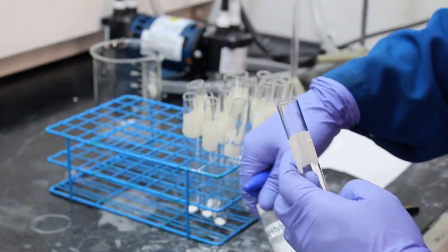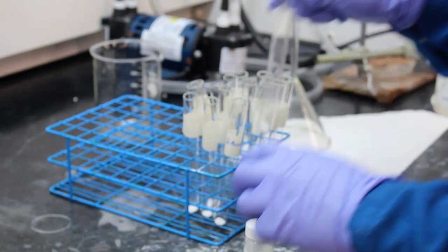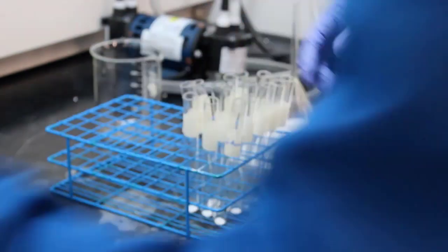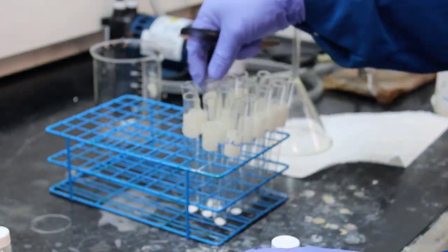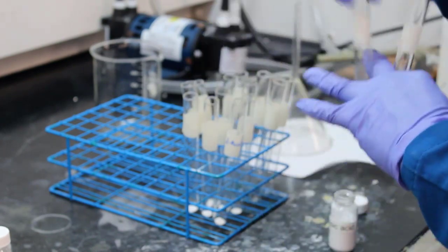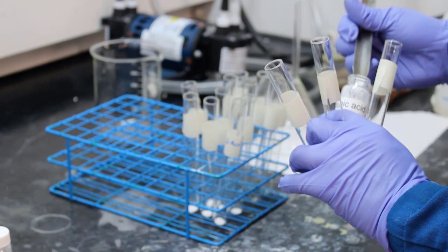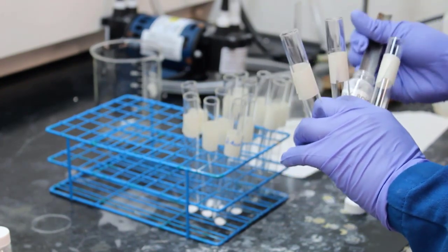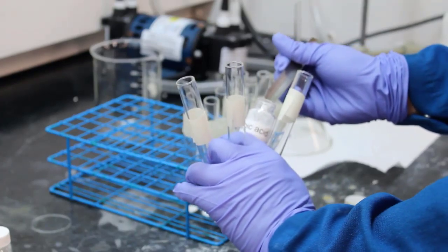All right, so we're in the setup stage. We see that they have acetylsalicylic acid that they're putting in test tubes. Now they're doing adipic acid into 3 different test tubes. It says a small scoop. Isn't it great that we don't have to weigh out each one of these small scoops? That could get troublesome.